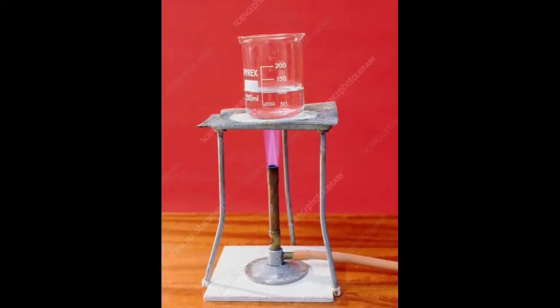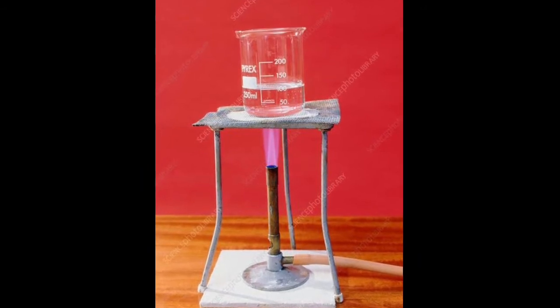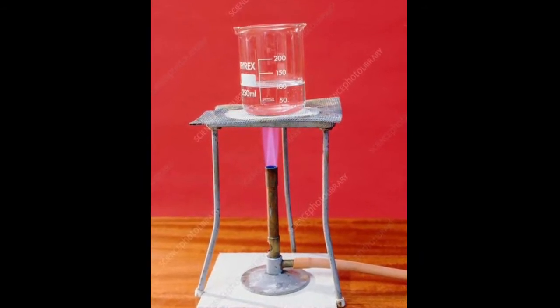Take a 250 ml beaker and pour 100 ml of distilled water and heat the water till it starts boiling.